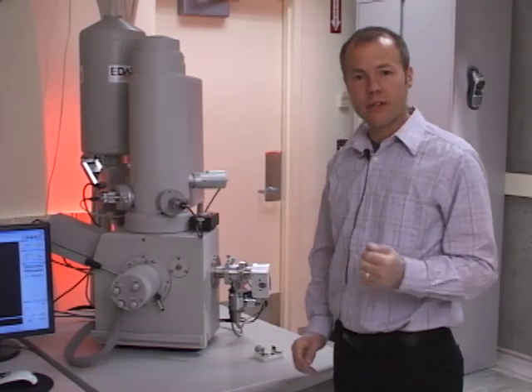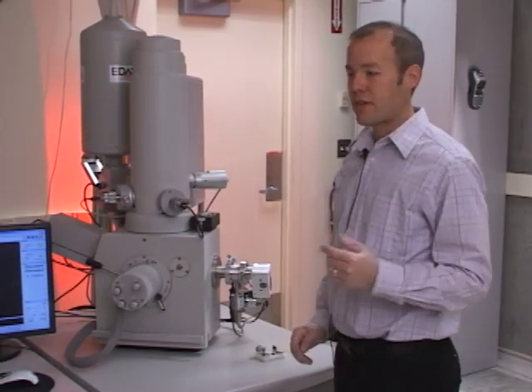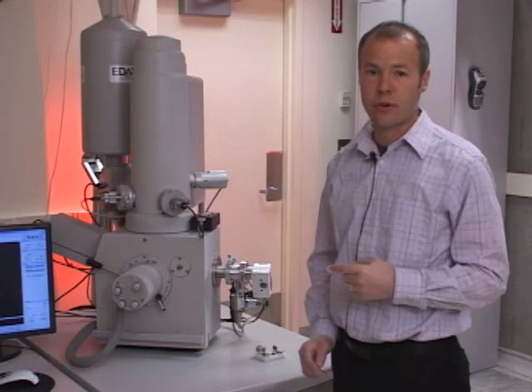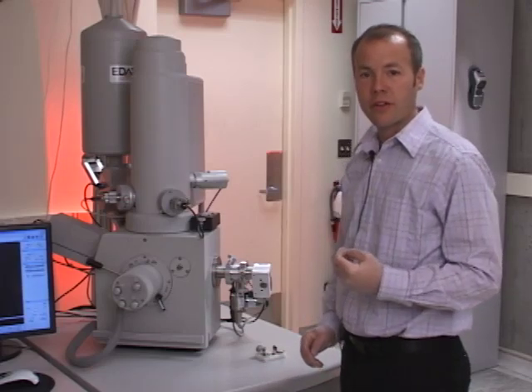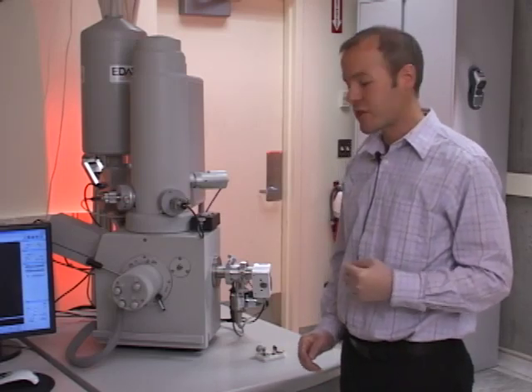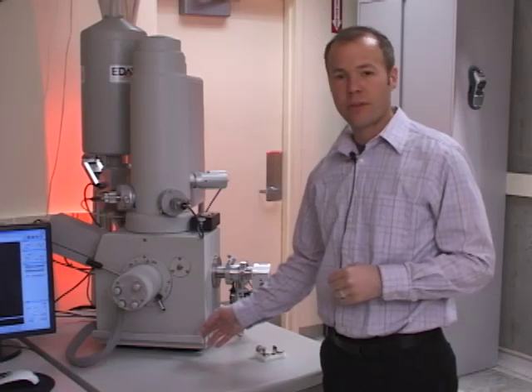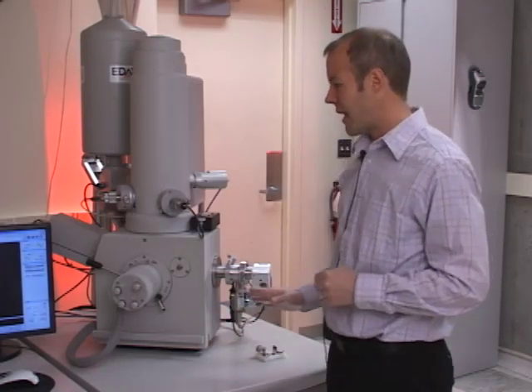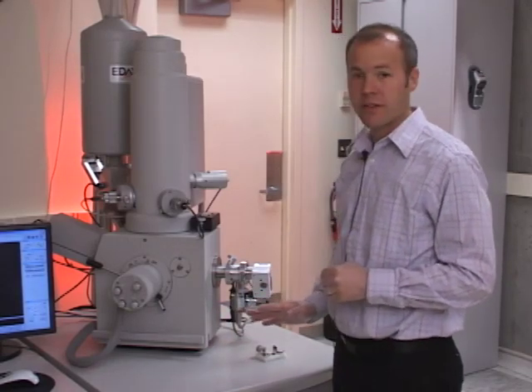And you'll hear the chamber filling with nitrogen. That's a nitrogen cylinder that's located in the next room. It takes about two minutes for the chamber to equalize to atmospheric pressure.